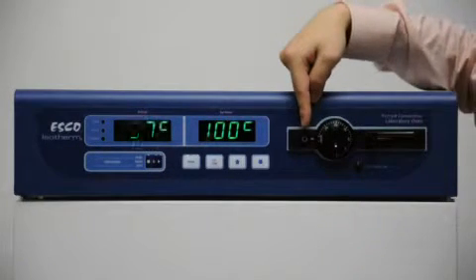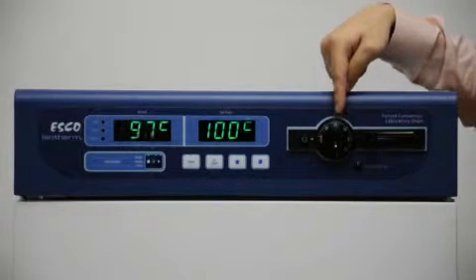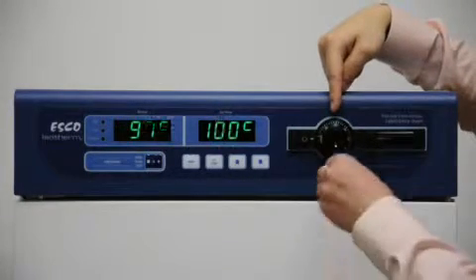We have a mains power switch and an independent adjustable over temperature thermostat. Let me demonstrate how this works.